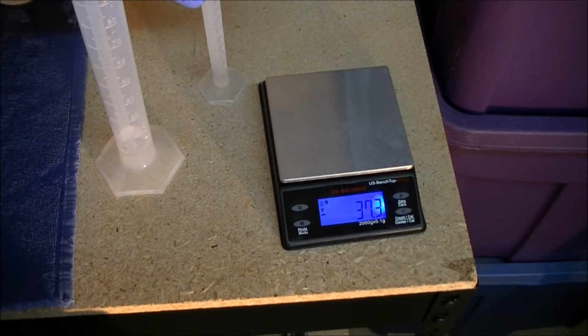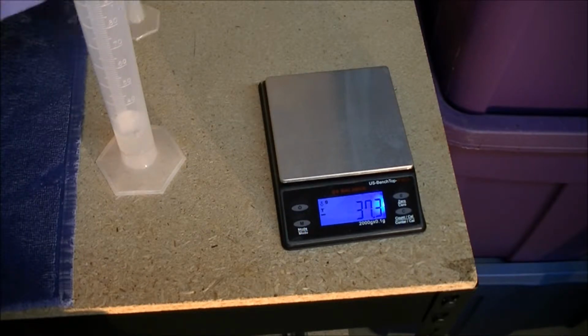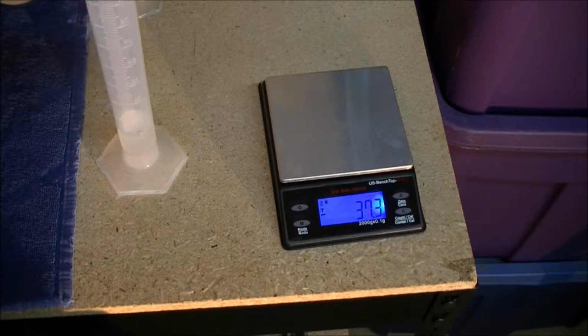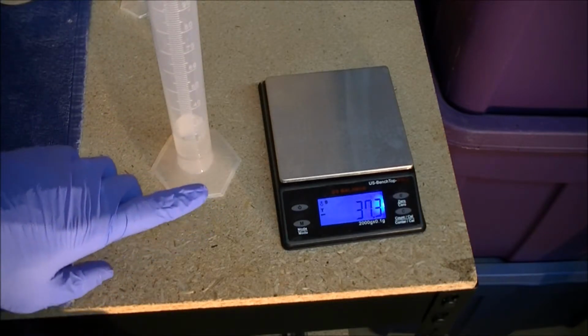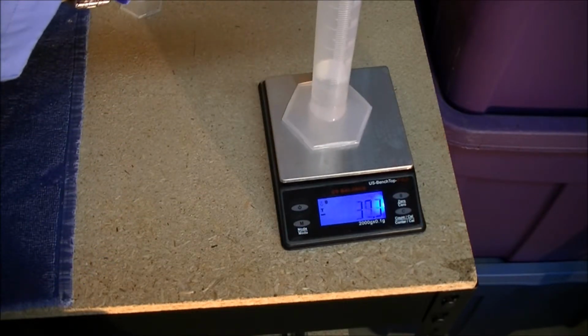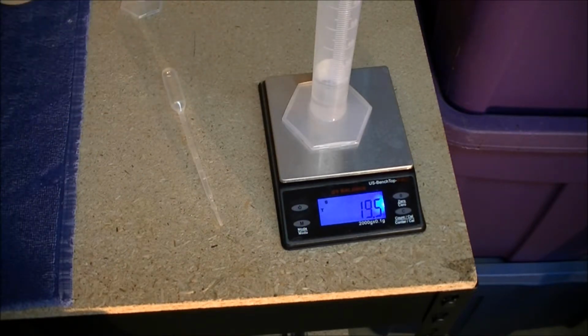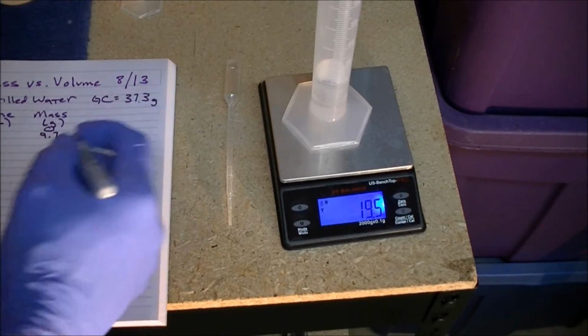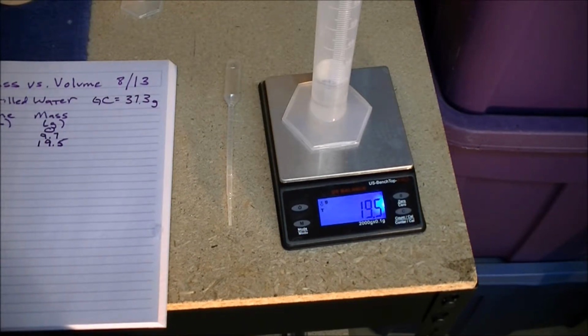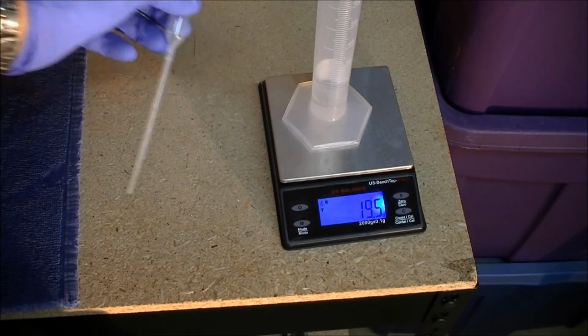The smaller graduated cylinder is particularly convenient for adding additional water in increments of 10 milliliters, but we don't completely trust just the fact that we added it from the smaller graduated cylinder. We go ahead and get down there eye level and check that the meniscus does line up with the 20 milliliter mark, and then we write down the next mass. This is the mass of 20 milliliters of water, 19.5 grams. Now we'd be prepared to top it off if the meniscus didn't line up just right.